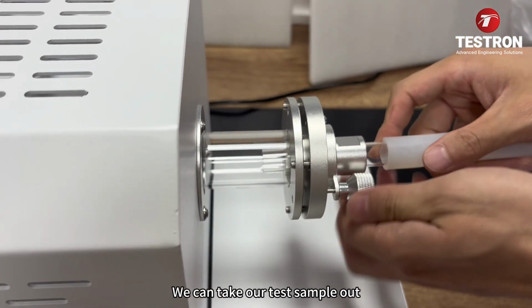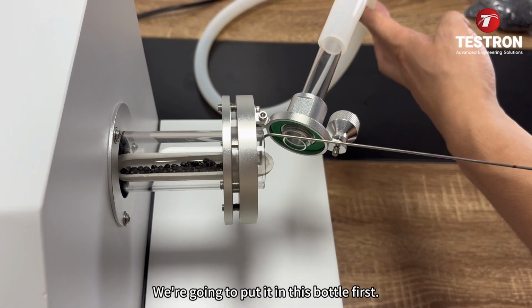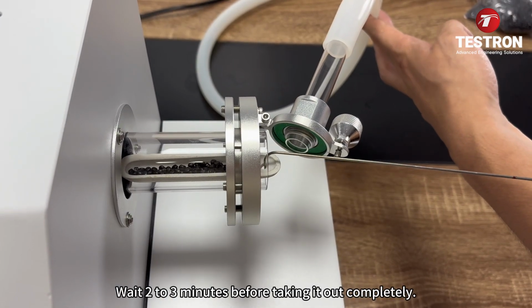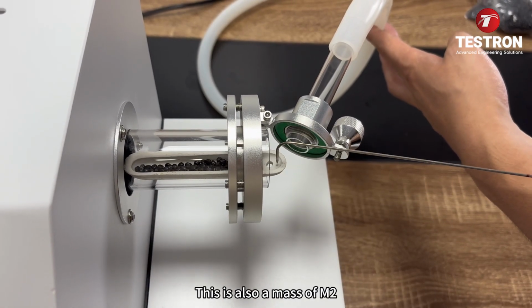we can take our test sample out. When we take it out, we put it in this bottle first. Wait 2 to 3 minutes before taking it out completely. Let it stand normally for 10 minutes. Weigh this burning boat and sample. This is also the mass of M2.